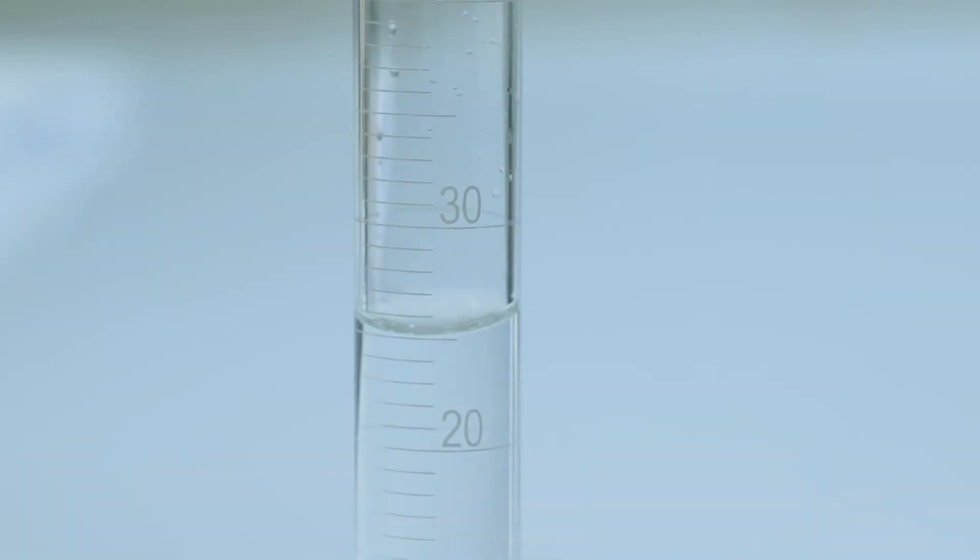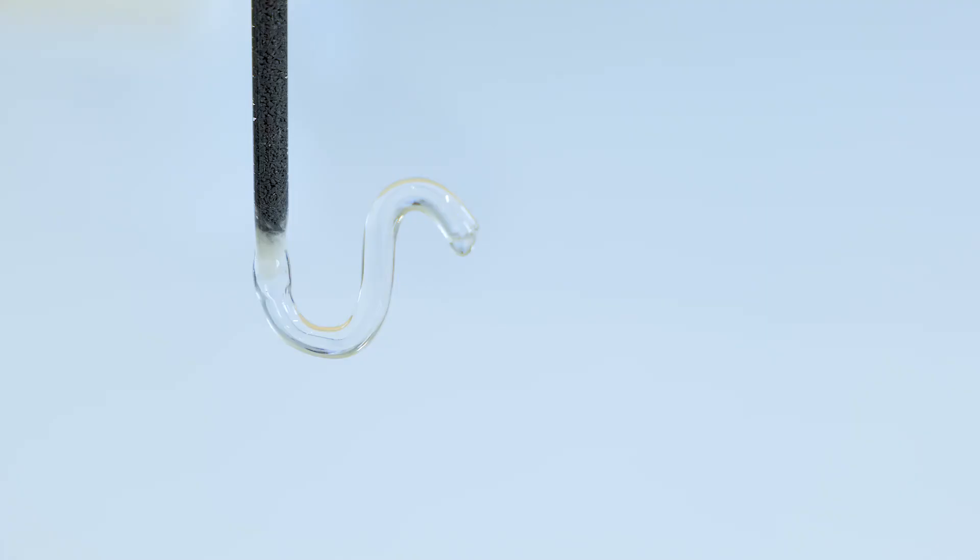Discard the first 25 milliliters. Collect the rest in original sample flask.